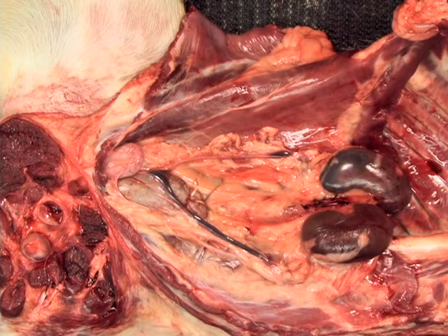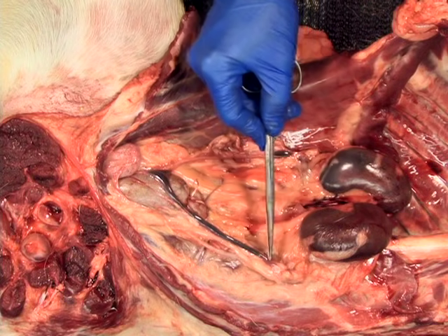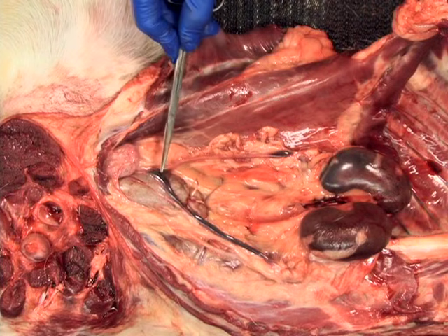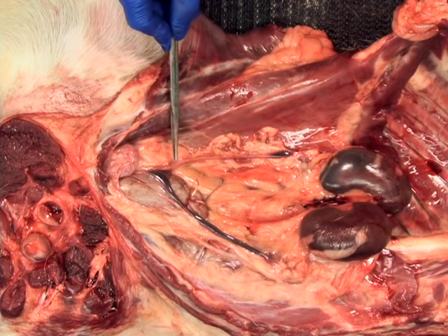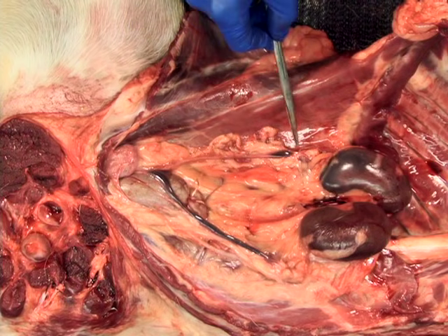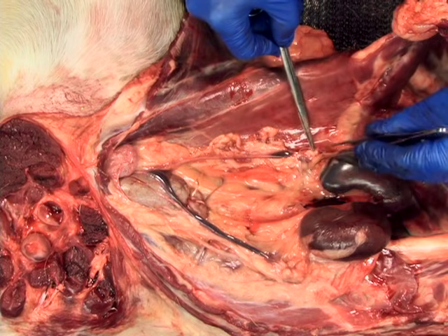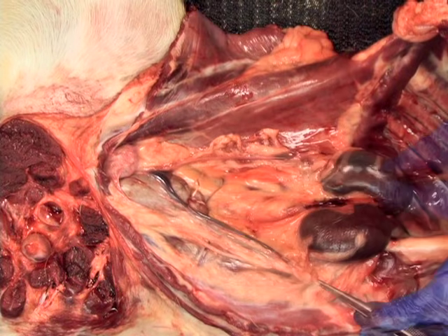In the intact female, first locate and then remove the ovaries, uterine horns, and uterine body by severing the suspensory and broad ligaments. In the intact male, move the testes from the scrotum and spermatic cords from the inguinal canals into the abdomen. Dissect the penis towards its ligamentous attachment at the caudal aspect of the pelvis.